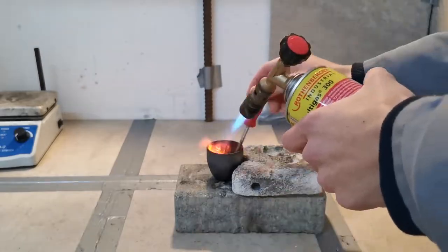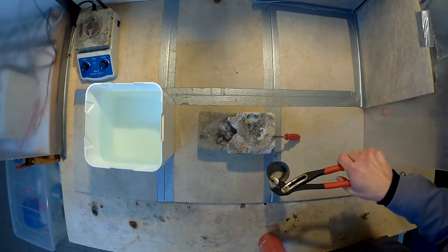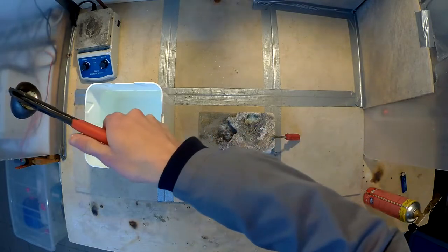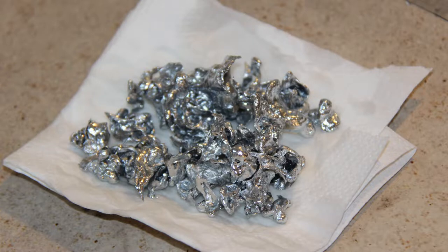To do this, I just had to heat it to around 420 degrees celsius and pour it in some water, trying to leave as much of the slag behind as possible. Now that I have some nice clean zinc metal, I weighed it and it turned out to be around 66.5 grams.